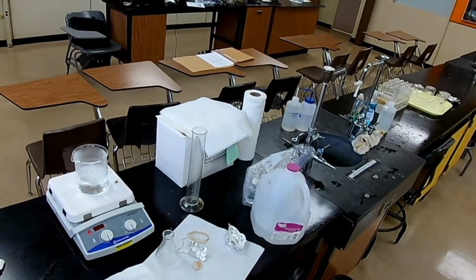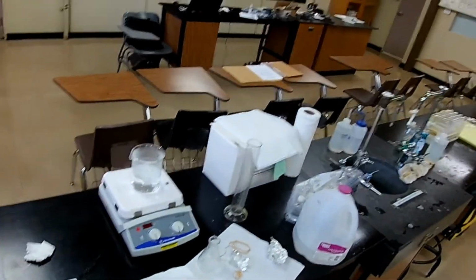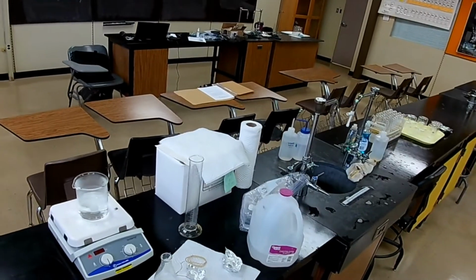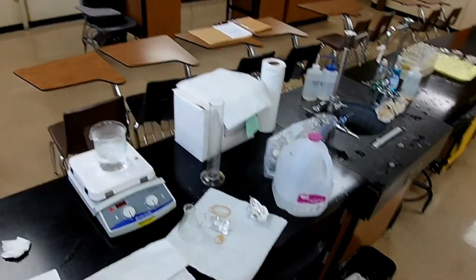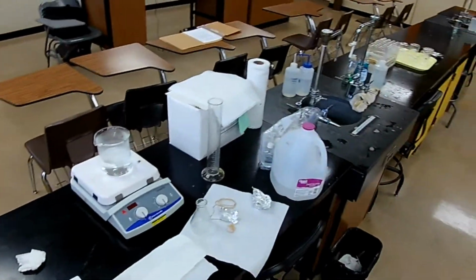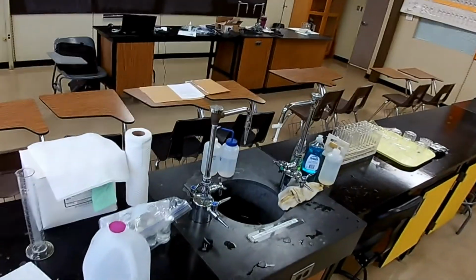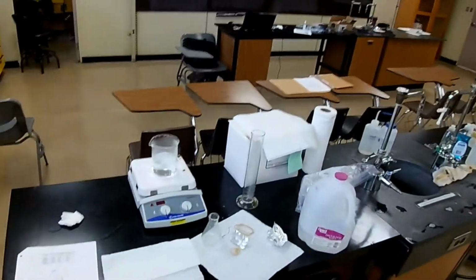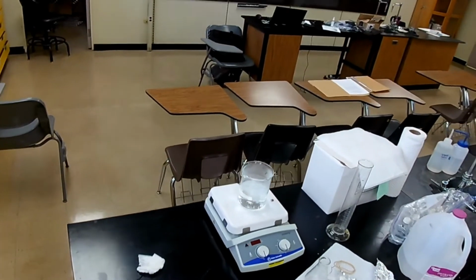Okay, that's the procedure in numbered steps. What actually happened? Then you follow that with data. Right? We collected data. There it is. Got to have your data. Then you have calculations. What calculations were performed? Derive the formulas. If you're going to use that single formula, you better derive it. Show me that you know what you're doing.